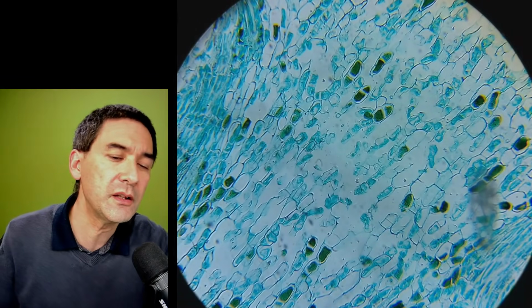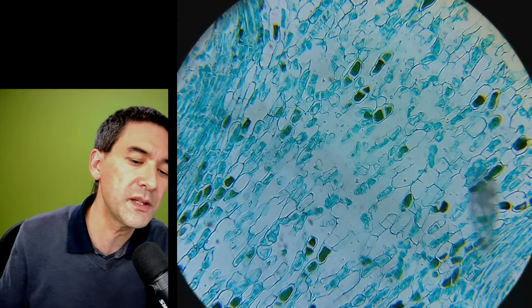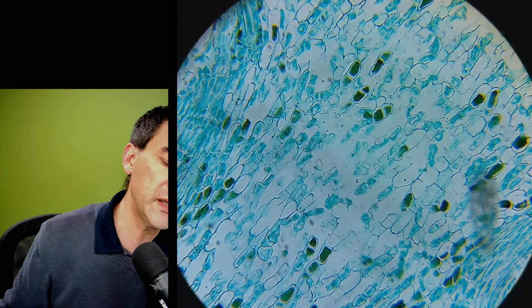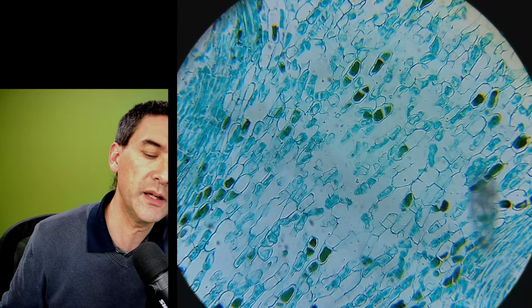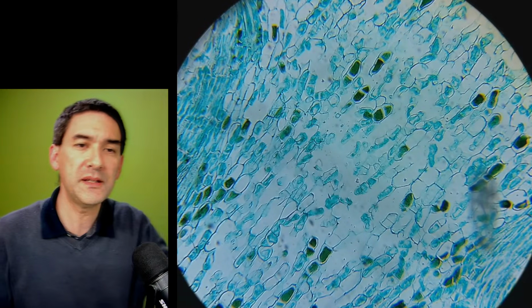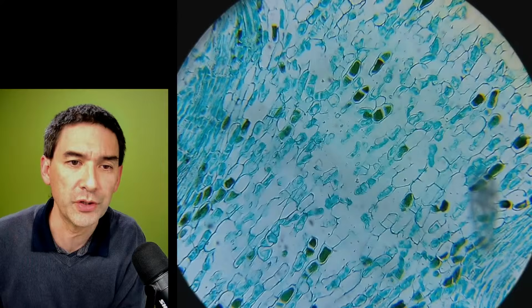You might also see that the camera starts to refocus every now and then. I need to quickly, and what I can do is switch over and lock the, what do you call this? I can lock the, I press. Yeah, and now basically I locked the focus and also the exposure.